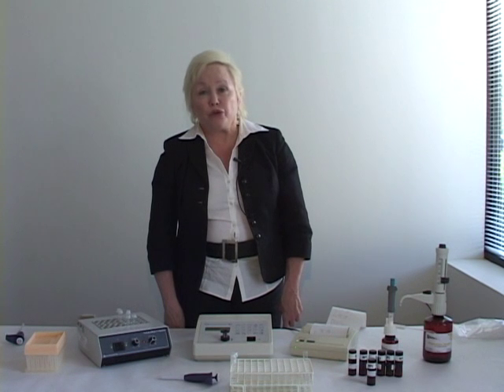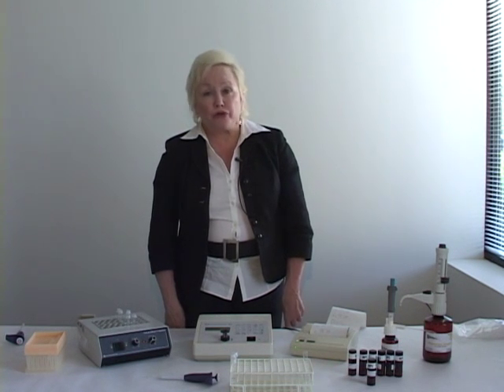I think that if you will practice the methods as we've gone through it in the training a couple of times and run a few samples, you will find that in fact it is an easy, rapid method that can either replace your GC for routine testing or be used as an adjunct to GC or outside lab testing.